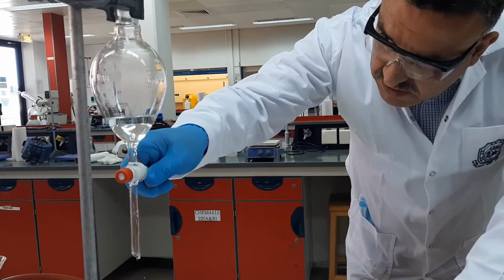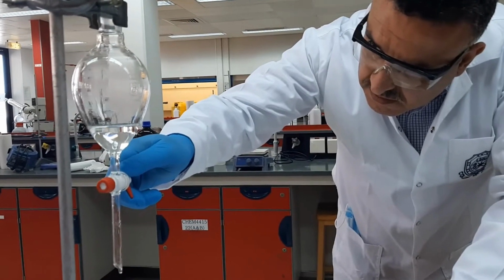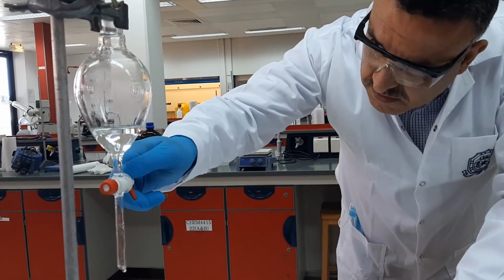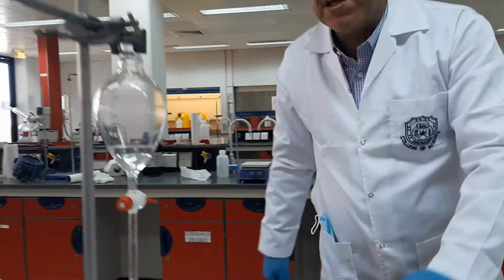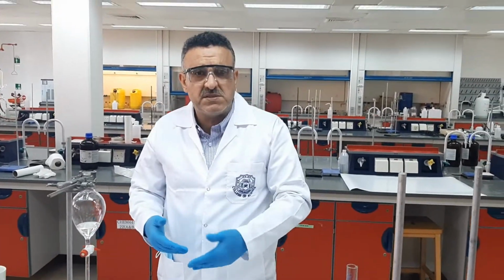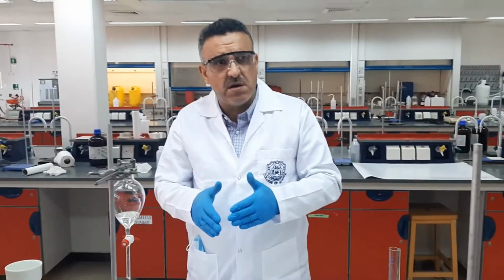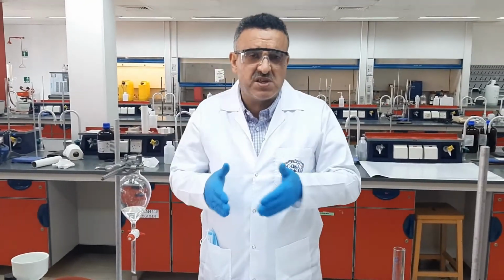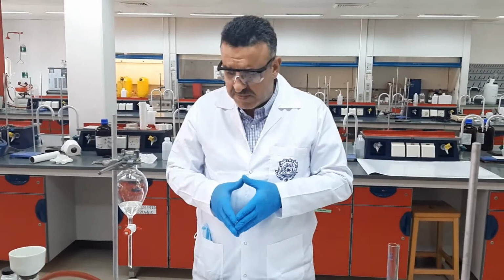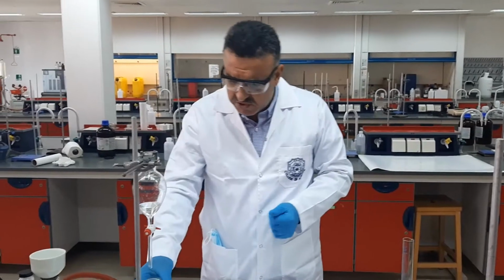All right, I think I should be careful now. All right, okay, perfect. At this point, as I said, you may repeat this step a few times in order to achieve the separation as perfectly as possible. But for this purpose, it is enough to show it to you twice.